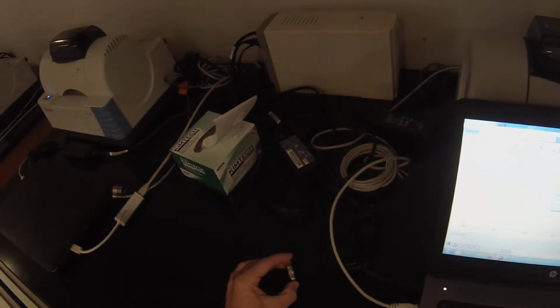So I'm going to put tryptamine in here for my title. And I'm going to type it wrong because I can't spell. And this came from ethanol, so tryptamine from ethanol. Please prepare to collect the sample. Put the little sample thing in there.